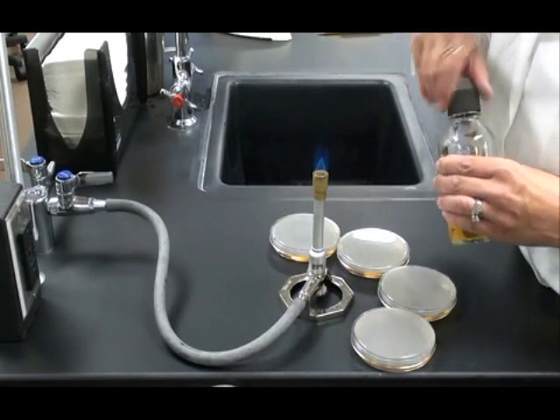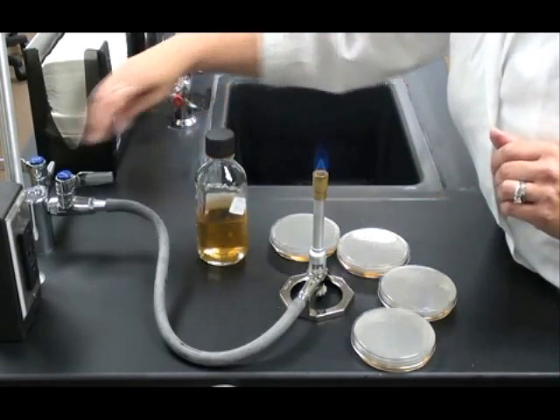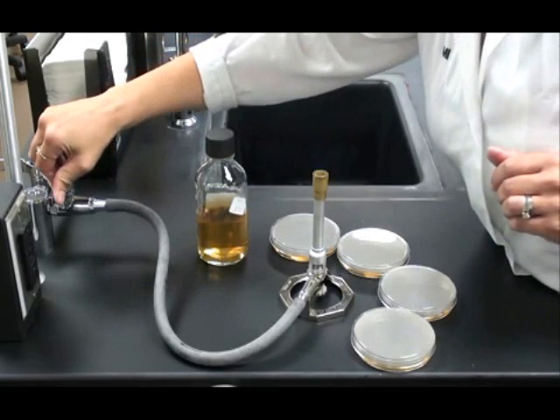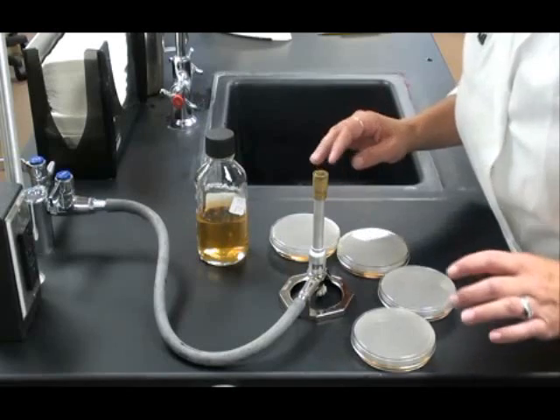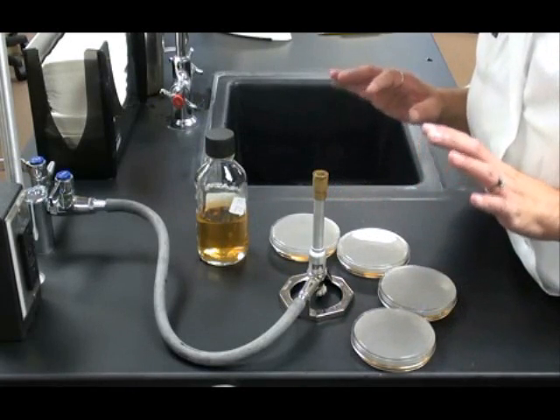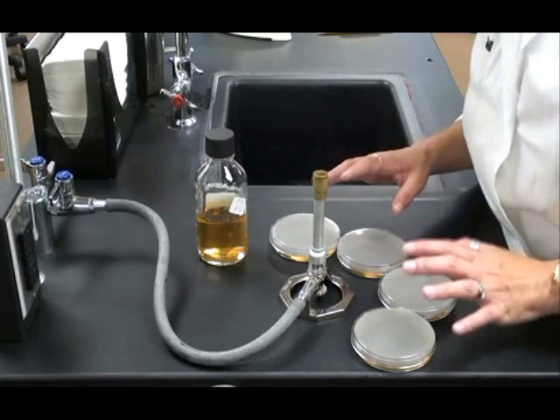I want to return that to the warming oven as soon as I've turned off the flame to my Bunsen burner. I'm all done with it, so I turn the handle so it's perpendicular to the nozzle. Do not move your plates for 10 to 15 minutes. They need that time to set up and cool off.